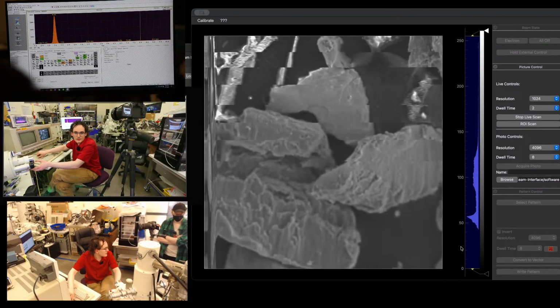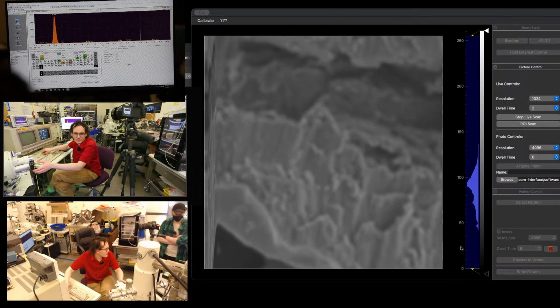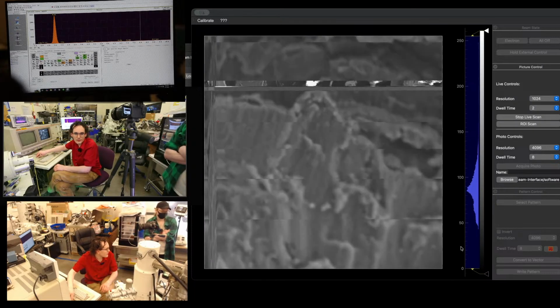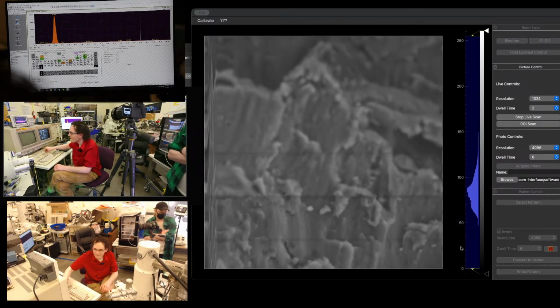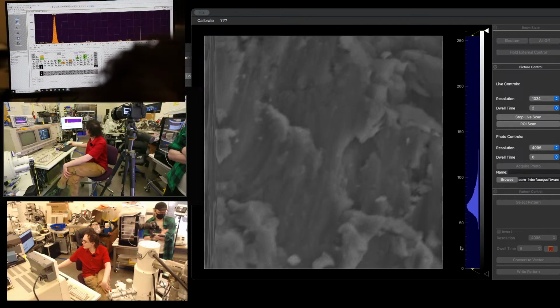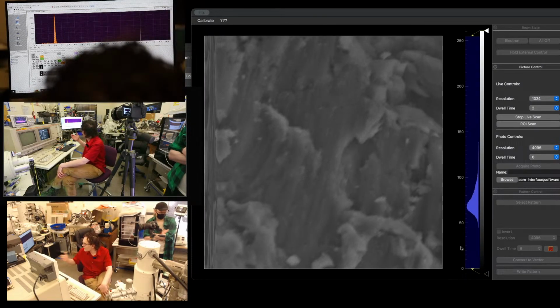But yeah, just look at the way that this fractured, you know? That looks like something high speed happened, which would align with our turbopump theory. Map Labs, what is your professional opinion here? I'm a little bit short on time tonight, so we are going to be wrapping up here in just a little bit, but we'll go ahead and shoot one more spectrum. Another very narrow aluminum peak on that one.